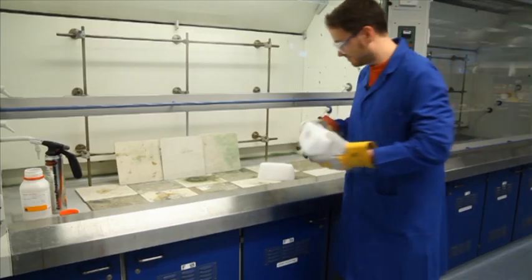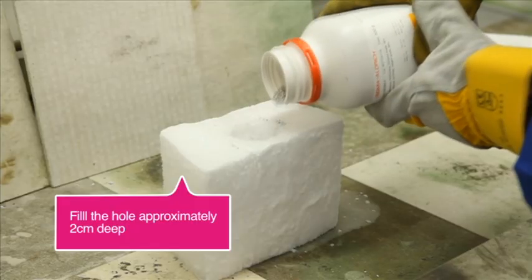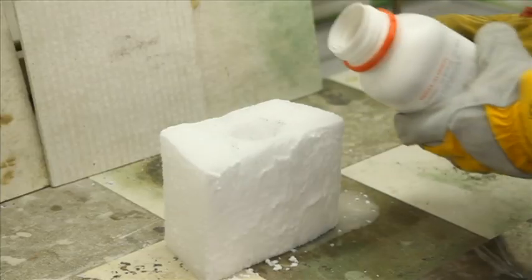Let's see what happens. Don't be tempted to fill the cavity too high, otherwise you can get sparks of magnesium that will fly out through the edge as you start to put the lid on.